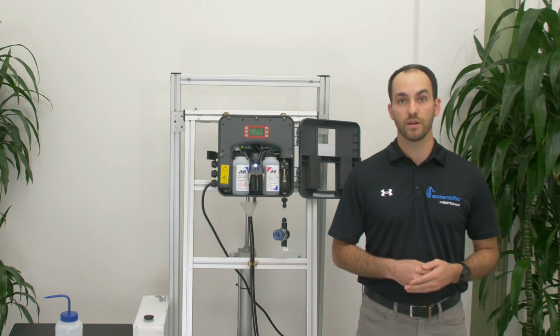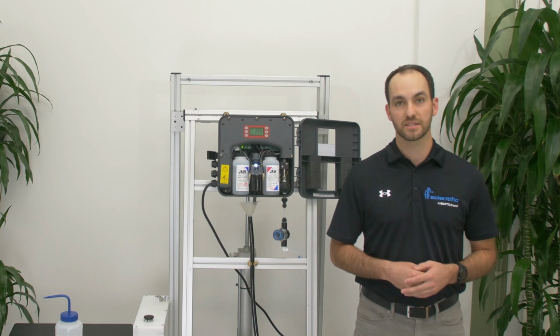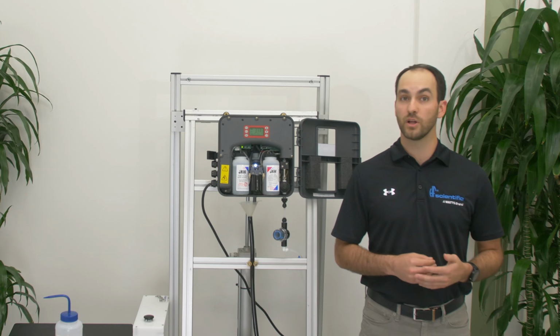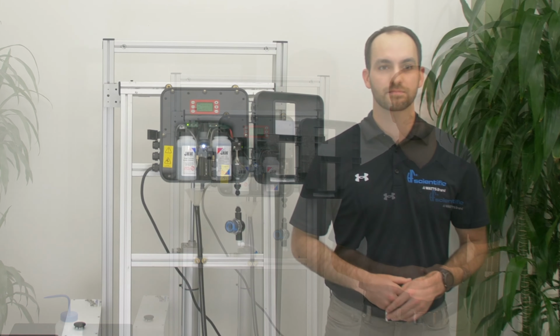GRN0, GRN1, GRN2 all have to do with the green lamp on the CLX. They indicate that the lamp is blown or stuck on. Refer to the HF Tech support team for more help with GRN issues.